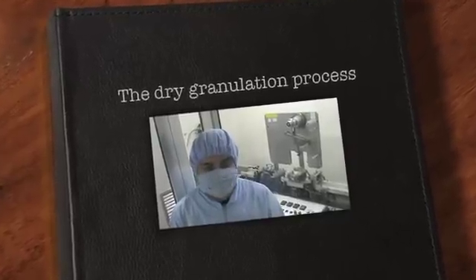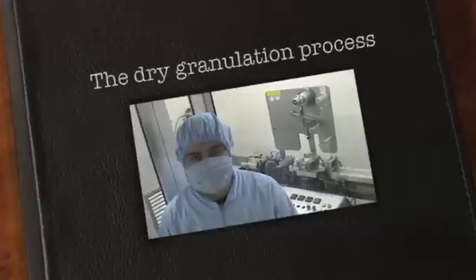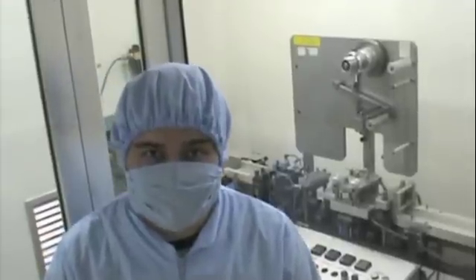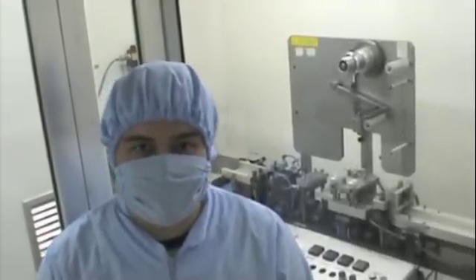Good afternoon, my name is Kevin Santana and today we're going to do a formulation with Metformin. Metformin is an API used as a first therapy for type 2 diabetes. The technology we're going to use is dry granulation.